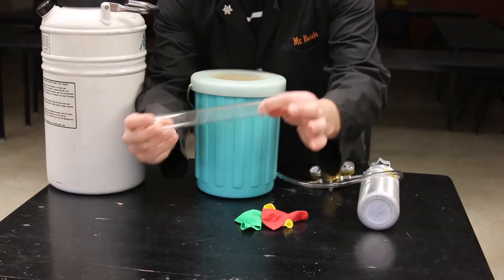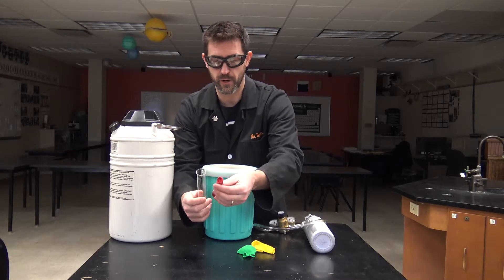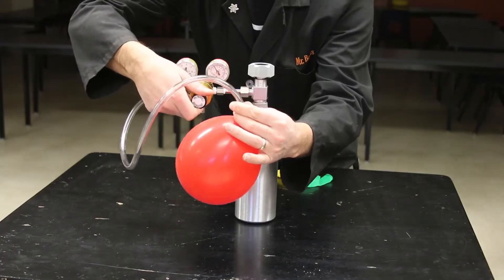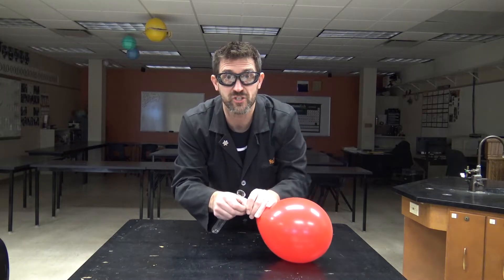Here's what we've got to do. We're going to take a nice large test tube, fill a balloon up with oxygen, and then put that over the top and start to cool it down. Let me put this down before I hurt myself. Here goes nothing — I'm going to put this over the top without losing all my oxygen.